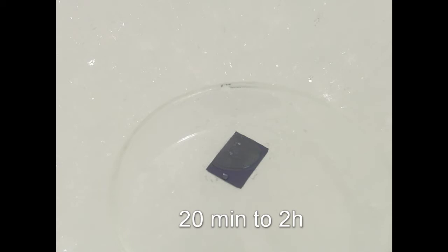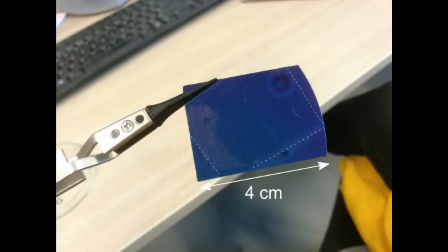In principle, there is no limitation for the graphene size that can be transferred to this method. Here, for example, we show a graphene sample that was transferred to a 4 cm silicon wafer. This sample will be further cleaned with a sequence of solvents as it is described in the paper.